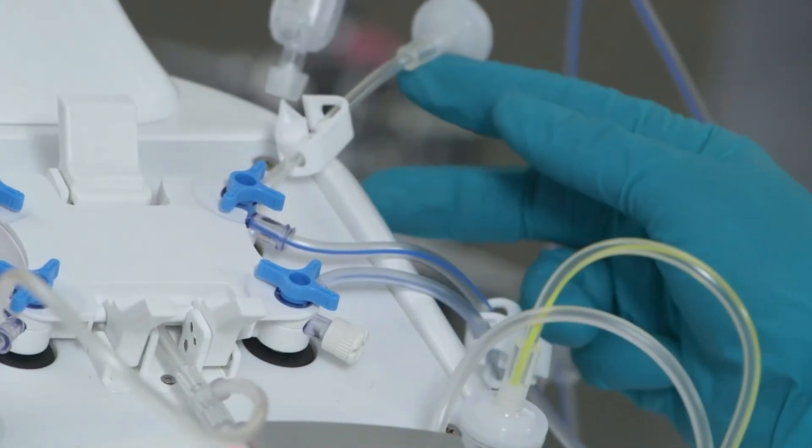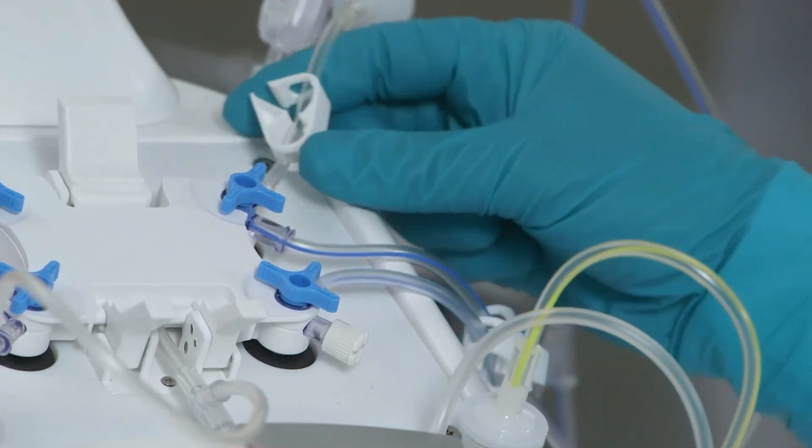Once all lines are installed and before connecting any product, close all clamps on the kit.